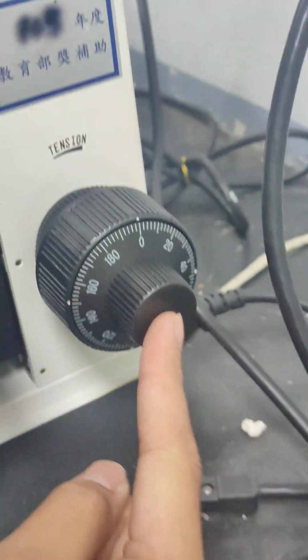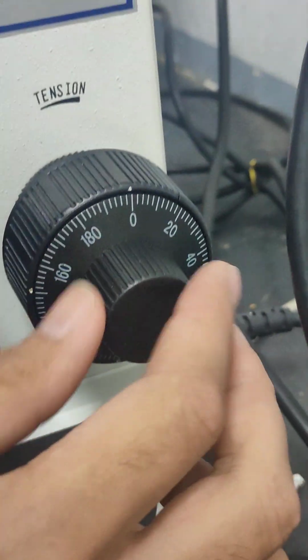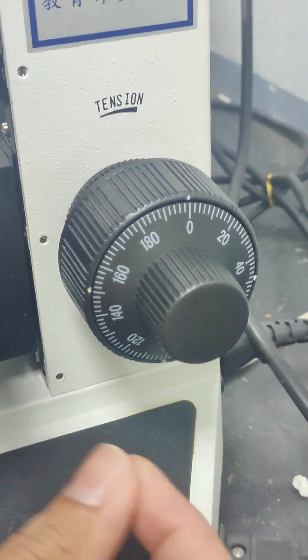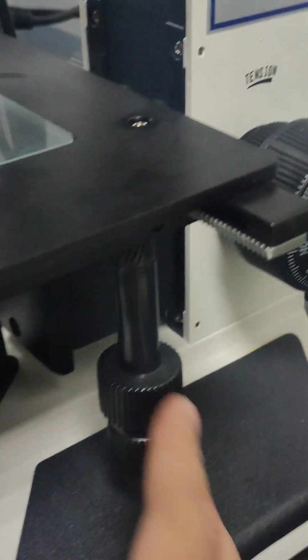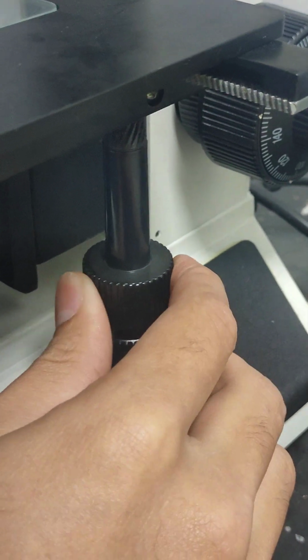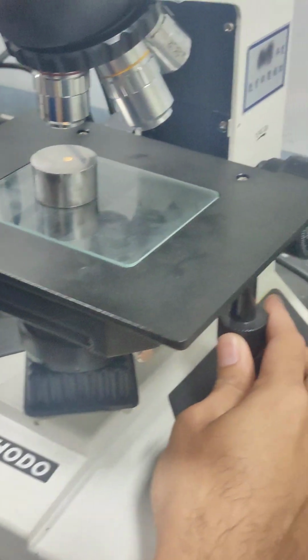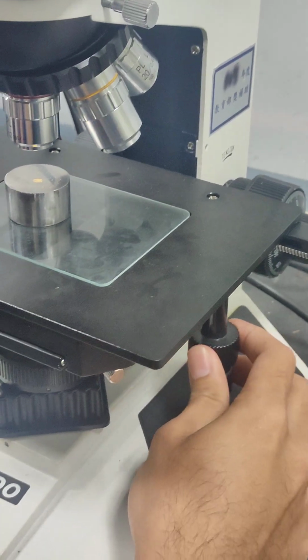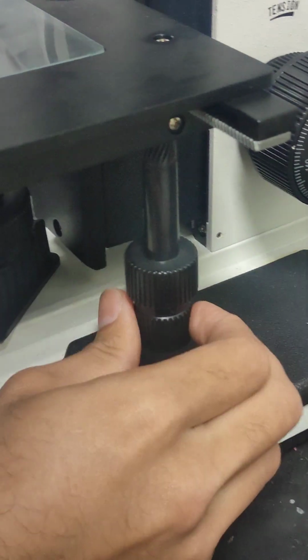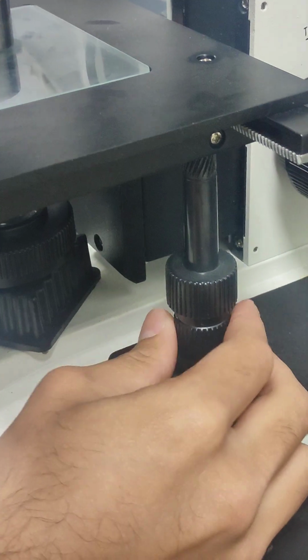Now you see this dial over here. This is what you use for the elevation of the specimen. But right now, I don't think we need to. We'll adjust it later. And then there are two dial controls. You can see here, it moves back and forth. You could consider this an X or Y axis, and this is your other axis, the horizontal control, where you adjust it all around.